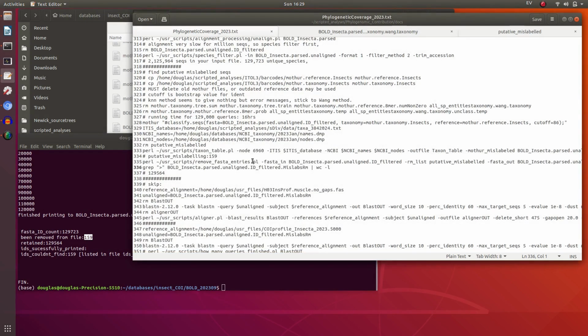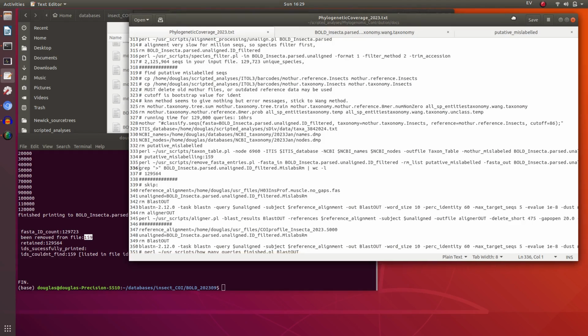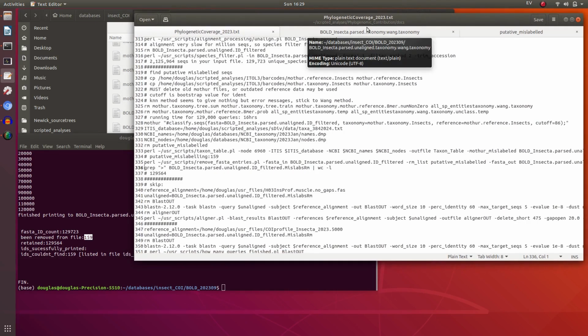So this looks at the order. So it is a rather broad mislabeling. I haven't really decided whether I should be doing that at a finer scale like family. I'm not really clear on that, but that's an option.